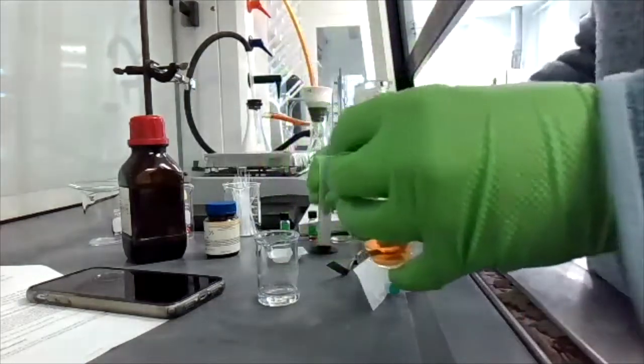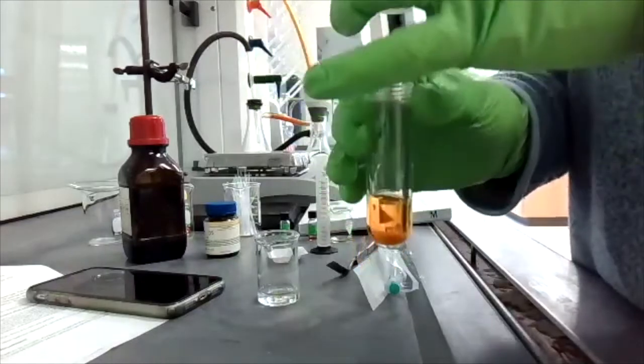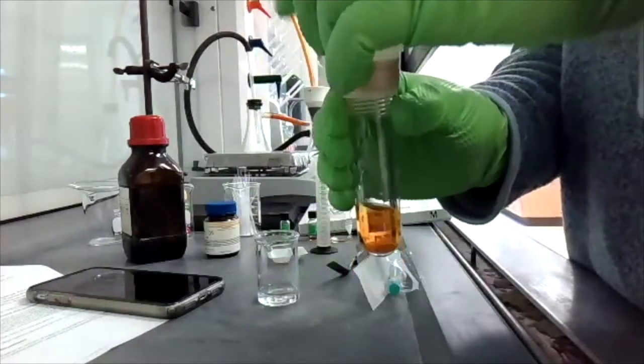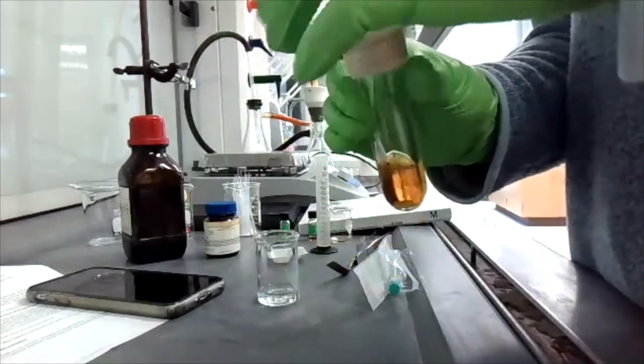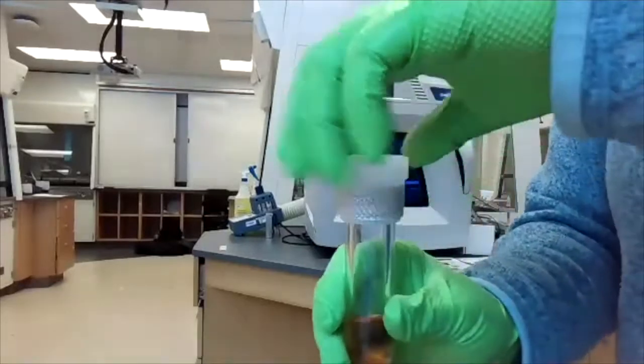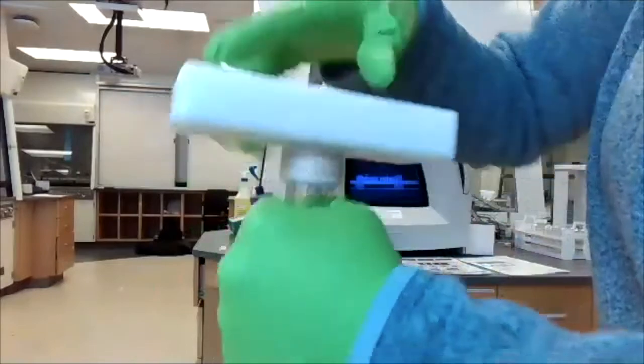Now you will place the vent plug on the top of the vessel and the vessel top, and at first finger tighten the vessel top to the reaction vessel, being sure not to over tighten it. Now you will obtain a torque wrench, and using the torque wrench you will tighten the top of the vessel till you hear a click.